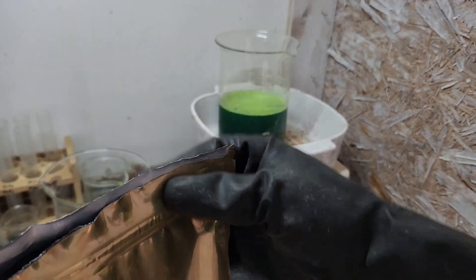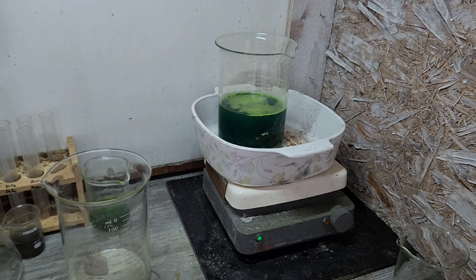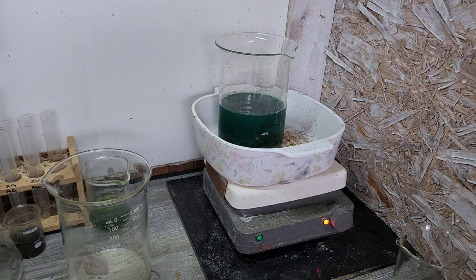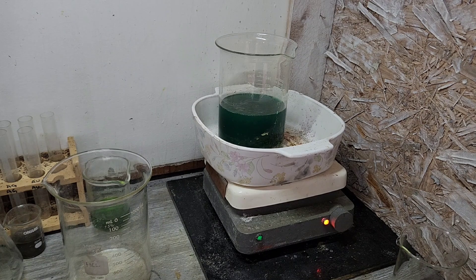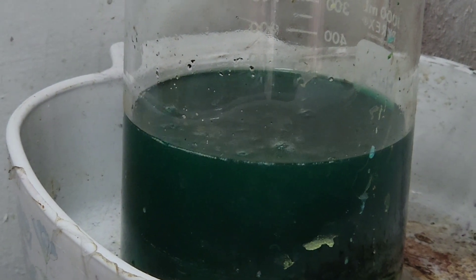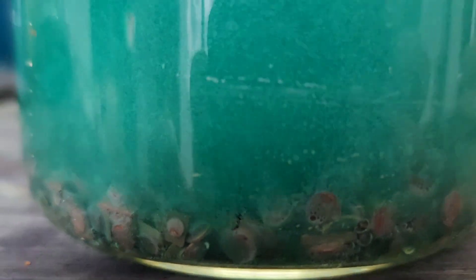So we didn't add any more sulfuric — we just did two more tablespoons of the potassium nitrate. Five pound bag, it was actually really cheap — like 18 bucks or something. Looks like we got the reaction back going. Let's get a close-up for you. Got the bubbles going back. Let's let it eat. Just like that, we're dissolving away.